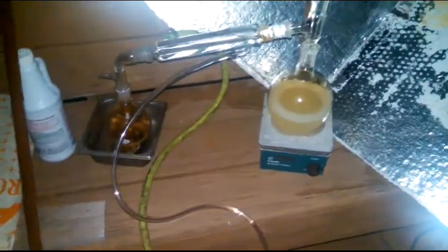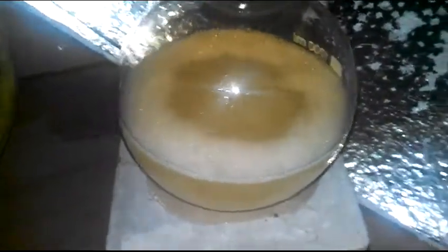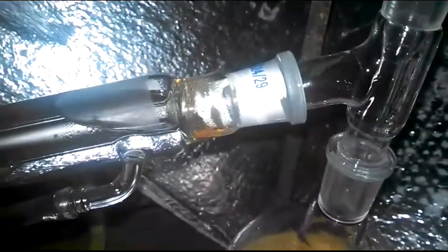Look at that. All right, well it's cleared up like I said it would and we're now putting over some really good acid. Really good acid.